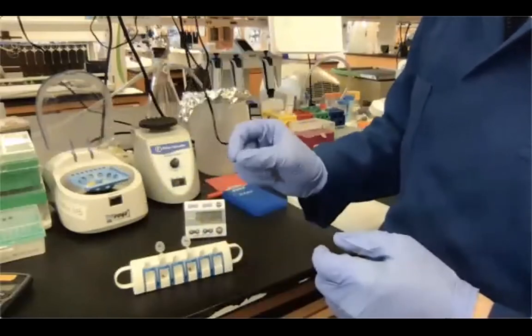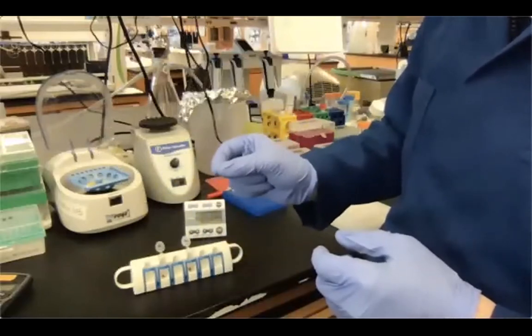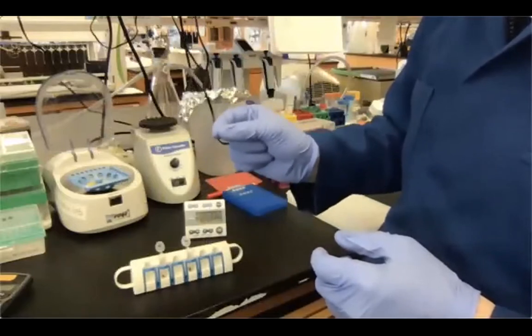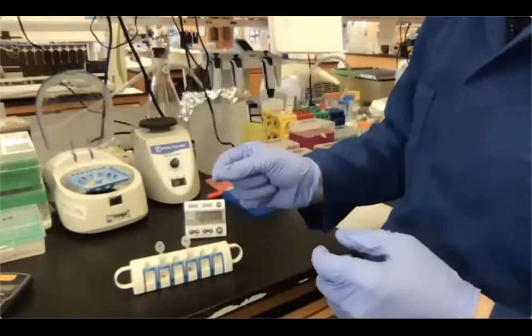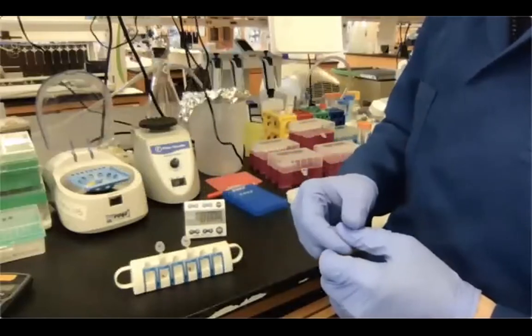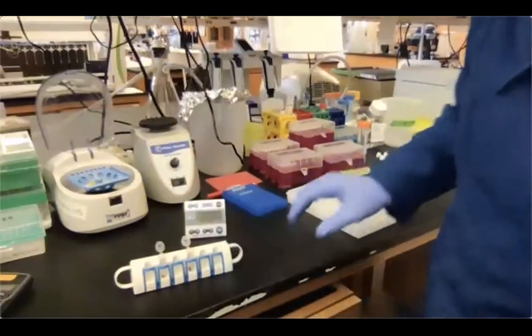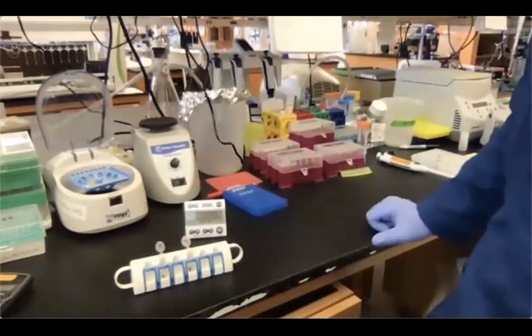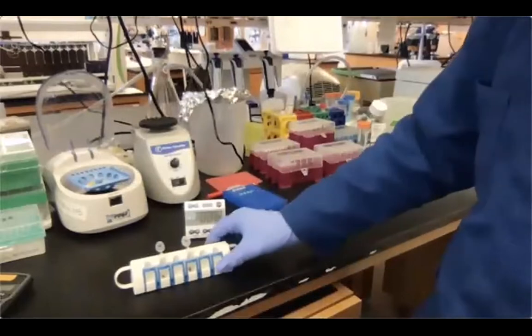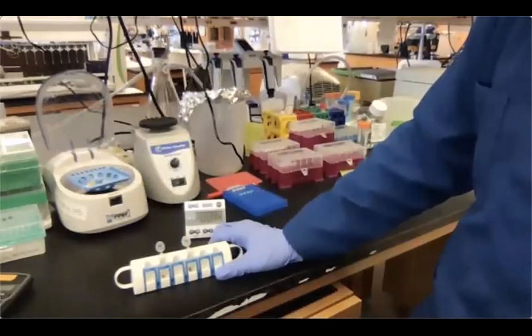You can also think of it as the bead pellet not resuspending into the 80% ethanol as easily as in the previous supernatant, okay? So in this case, what I like to use is actually a vacuum aspirator. So it's much stronger, it's cleaner.